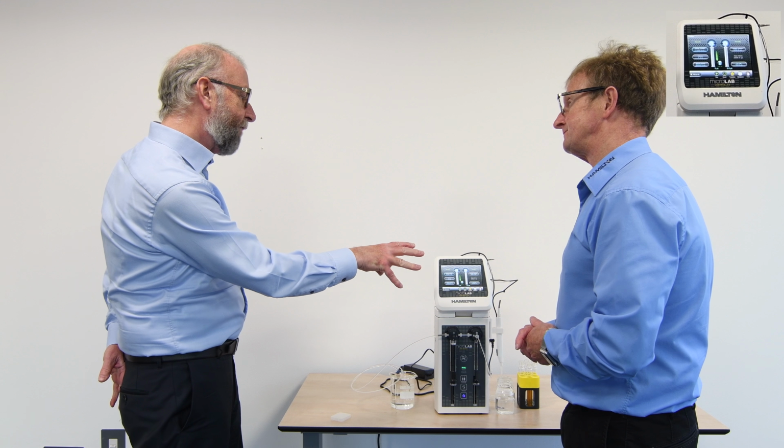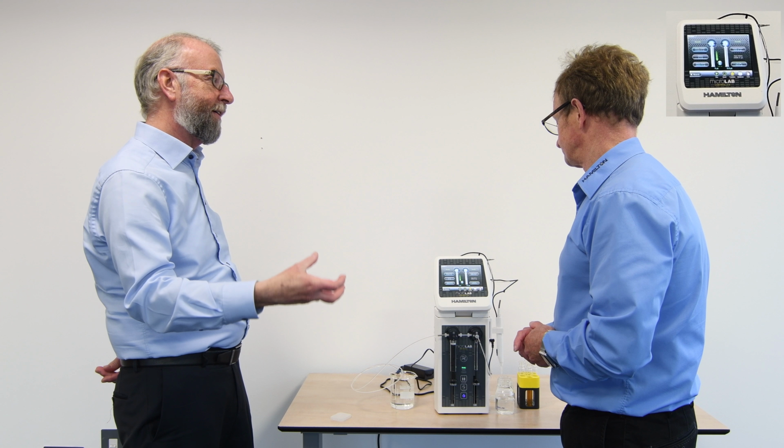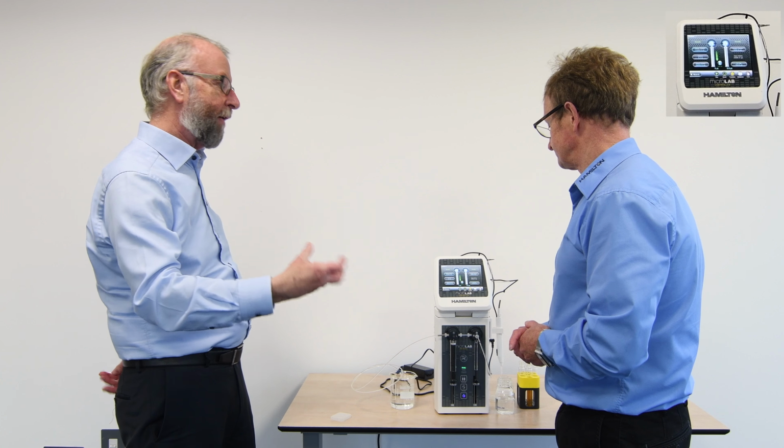So how do I save that? And if I've got similar applications, how do I then duplicate and edit? Because I have several applications that are similar, and I don't want to create new methods from scratch every time. Show me how to do that.